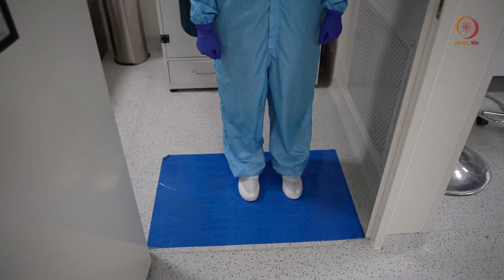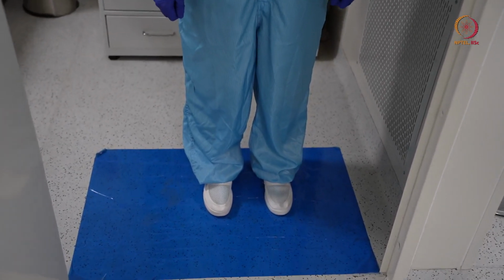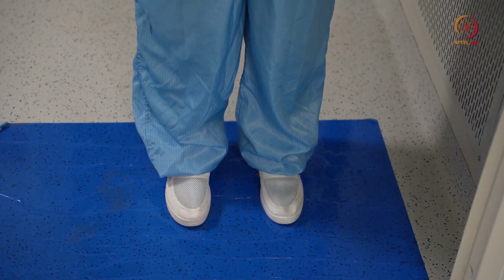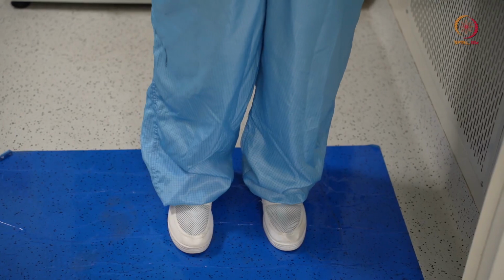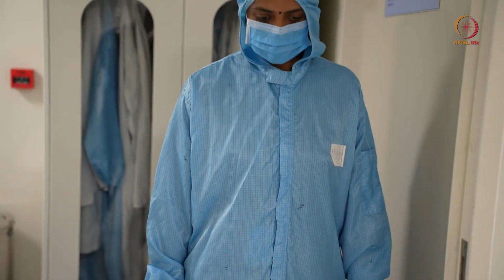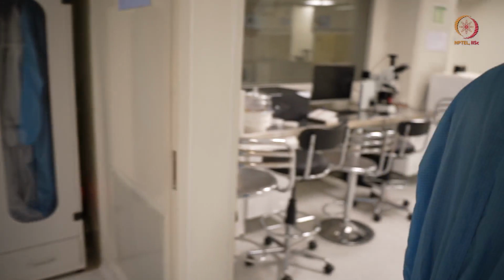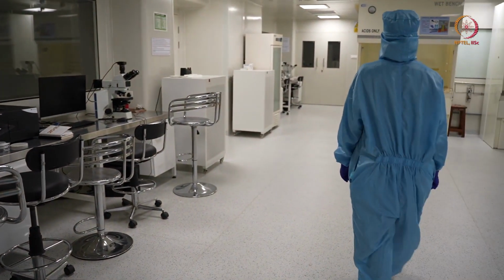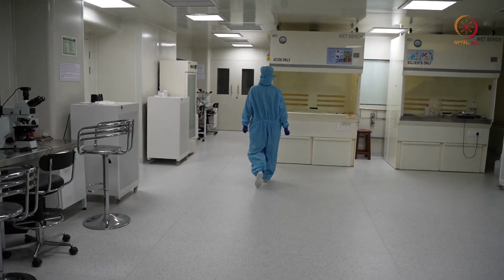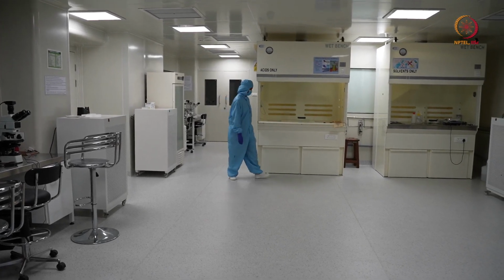So first she just stepped on the sticky mat, so that some dust particles, whatever below the shoe, will get stuck to the mat and she can go in after this. So see, she is going in, and whatever dust particles are there, that is stuck to the mat itself. So these sticky mats, after some usage, will be full of dust. That time you just remove one layer, put a new sticky mat. That is how you can keep the environment little more cleaner.